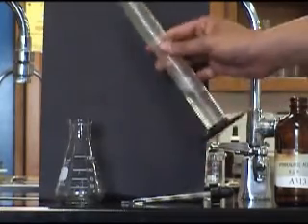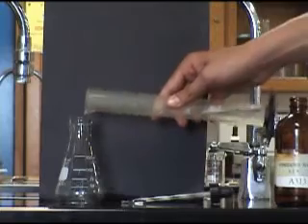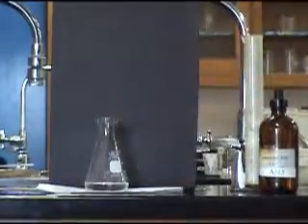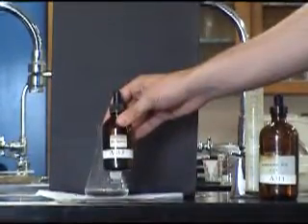Place a piece of paper underneath the flask to observe your observations later on. Before you finish your HCl solution, make sure to add two to three drops of phenolphthalein.